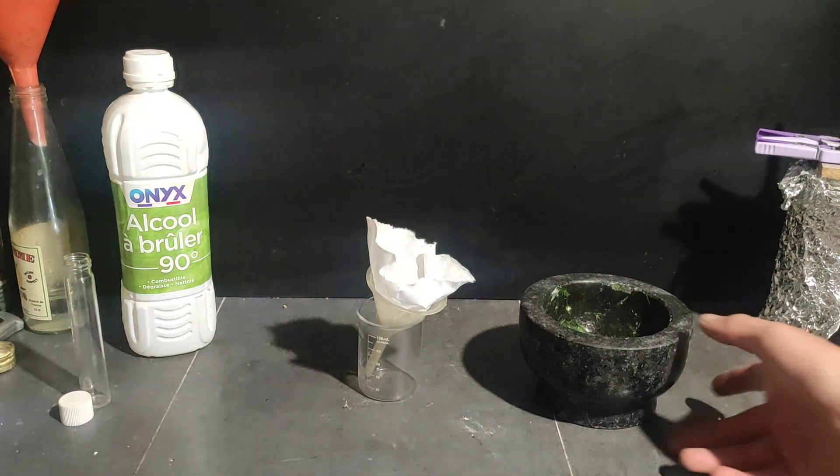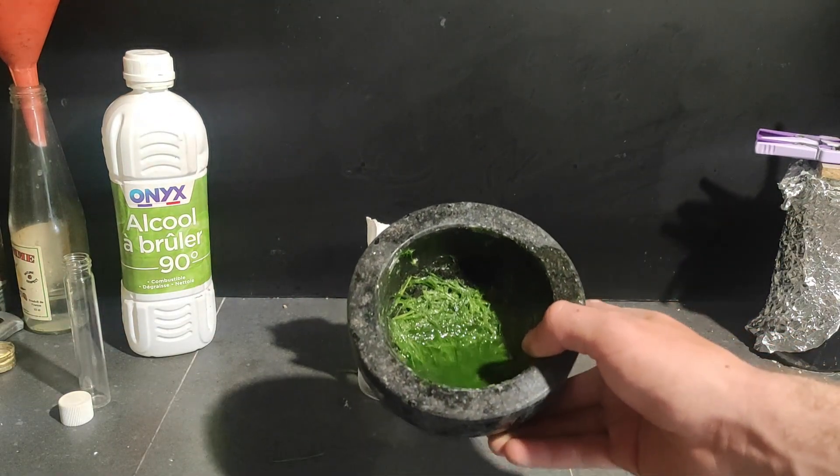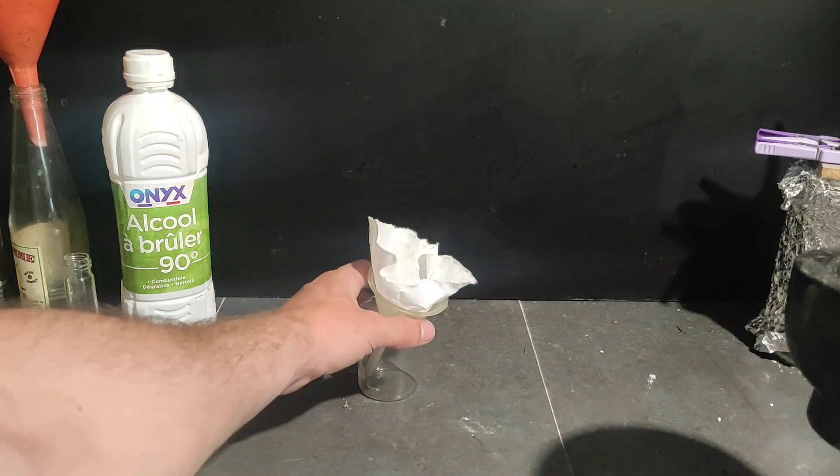Alright, so now we're gonna filter all of that into the beaker. As you can see here it has made a nice green solution, just gonna filter it now.